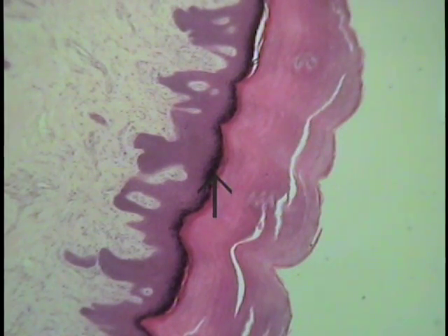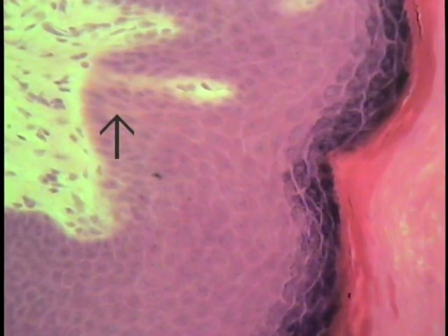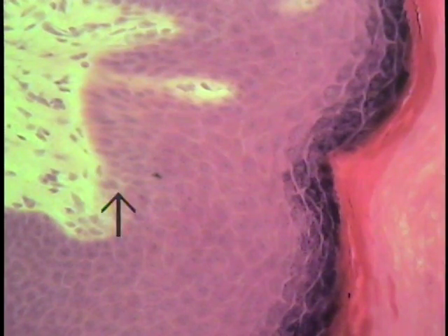The remainder of the epithelium begins about where the tip of the pointer is and extends from this location down to where the basement membrane would be located. So examine a section of thick skin briefly and compare it to that of the thin skin. Look at this particular section at increased magnification. The base of thick skin looked at increased magnification. Once again, this is where the epithelium begins. So it's lying on a basement membrane, though it's not completely visualized. One doesn't worry about all of these cells at the present time.